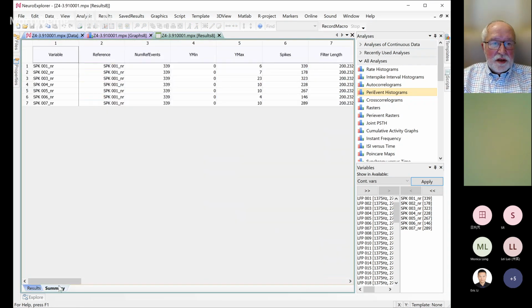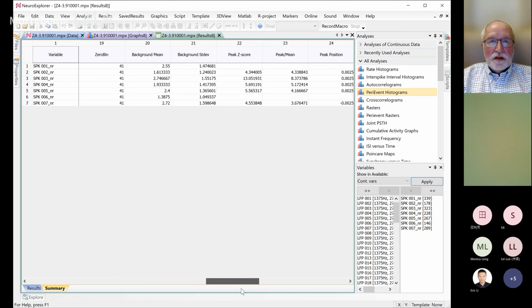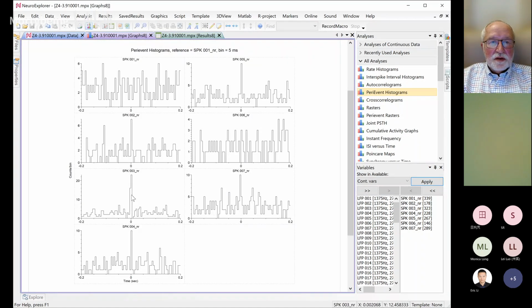In the summary, you can see the confidence and all kinds of background. You can find the peak position. For example, look here, we have zero bins before peak position. It says that for 003, the peak position is 2.5 milliseconds. So that's the position of this peak. That's the analysis. If you want, perievent rasters will also give you similar information, but with more details.